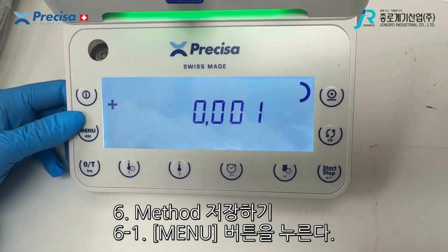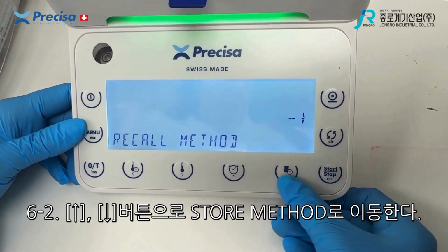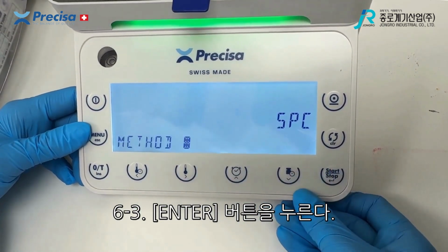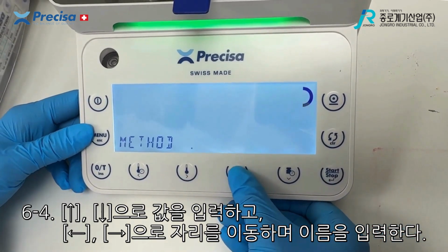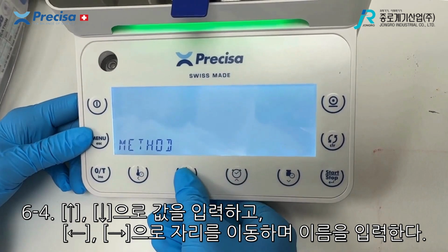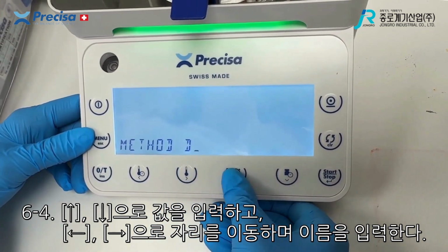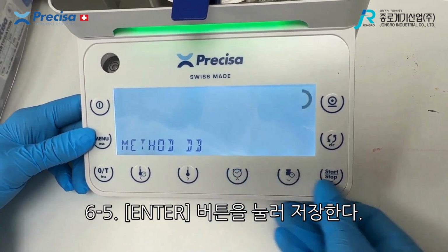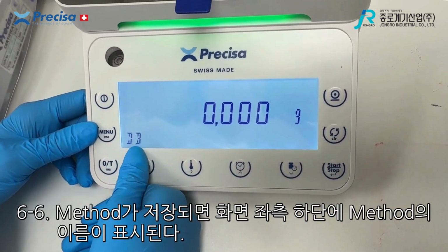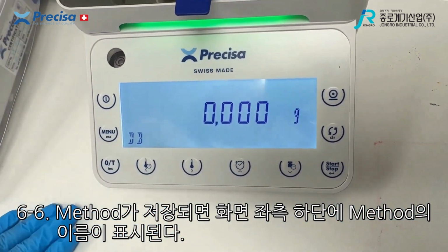In order to save the method, you press menu, you scroll down until you find store method. Press start. Now you can change the name of it. Just scroll through until you find the letter you require. You can change this, and once you're happy, press start to lock it in. And now this method is ready to start, and you can load your sample.